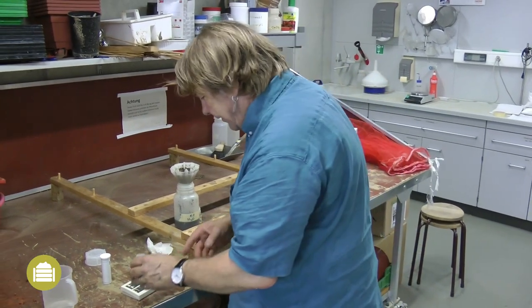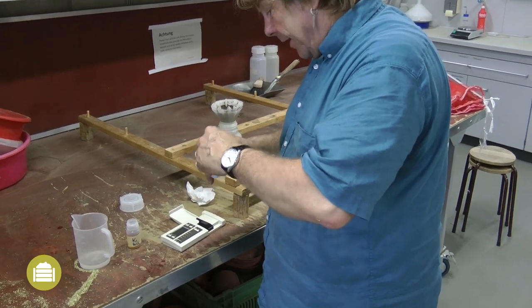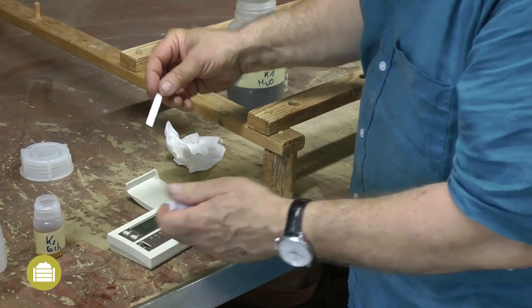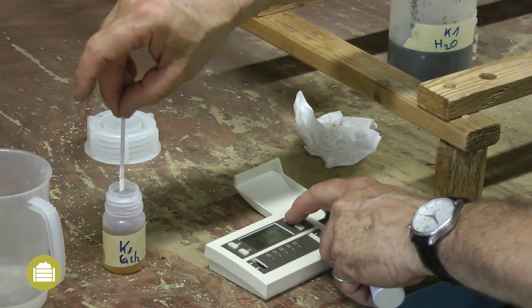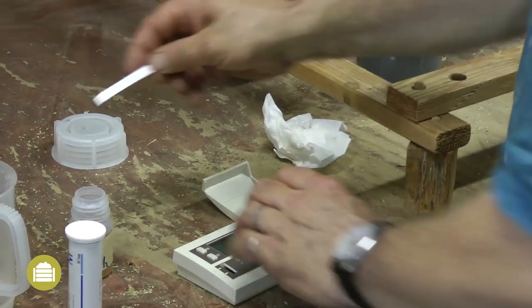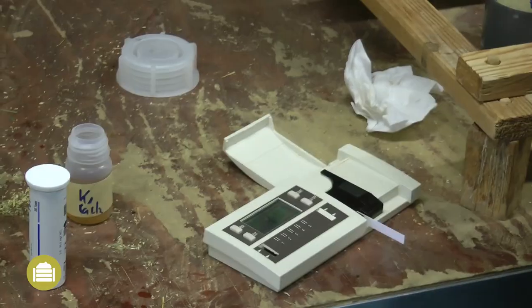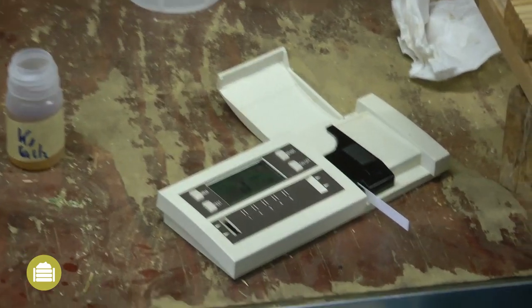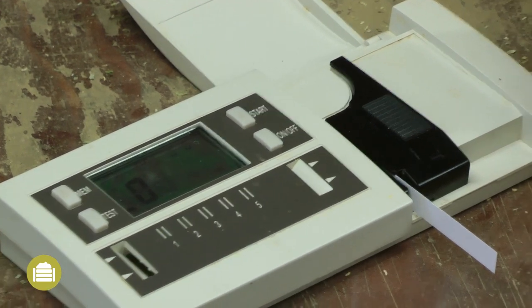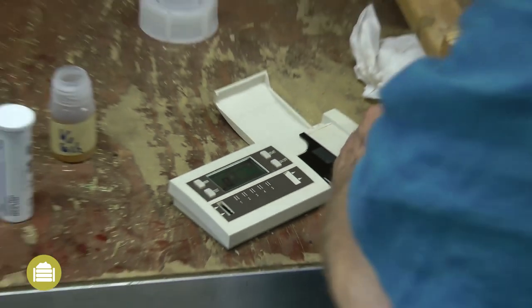I will start with the nitrite analysis. This is an apparatus for the rapid determination of nitrite. It is very simple and can be used under field conditions. A test strip is dipped in the extract and then inserted in the apparatus. After 15 seconds the result is on the display. In this extract we have no detectable amount of nitrite. This is a good sign — nitrite is an indicator that anaerobic conditions occurred in the compost, which is undesirable.